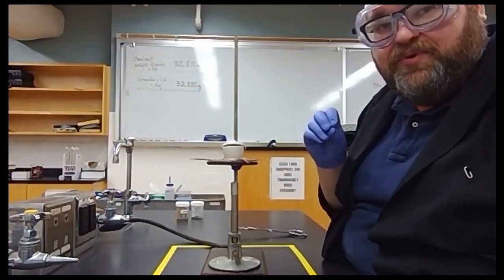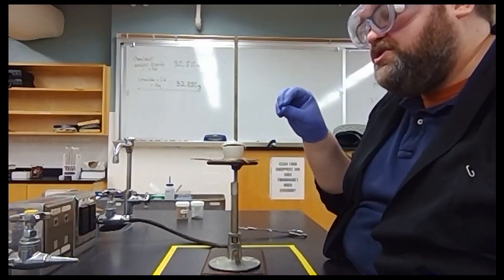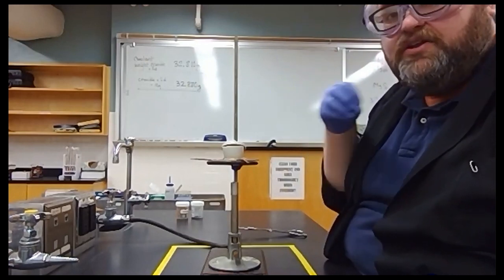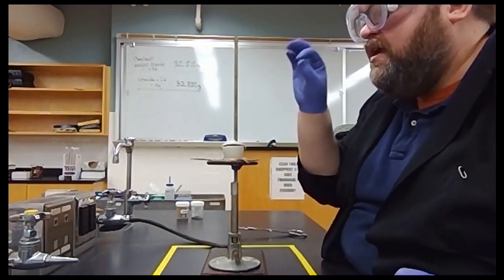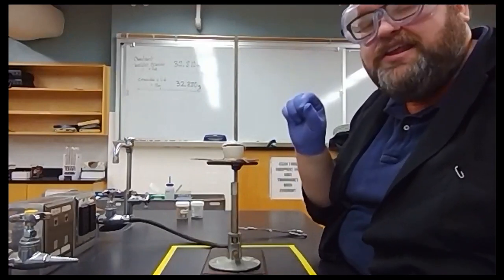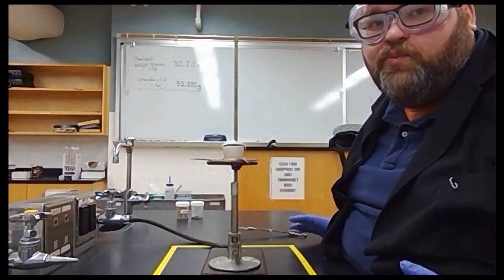But that doesn't mean that the reaction is over. There's still going to be little bits of magnesium that are going to take longer than others. So what we're going to do is periodically, once we've had that bright flash, come back in and look every 2 minutes, and see if there are any embers glowing, just like in a normal campfire. We're going to look for embers. If there are any red glowy bits, we're not done yet. We're going to let those continue to burn.